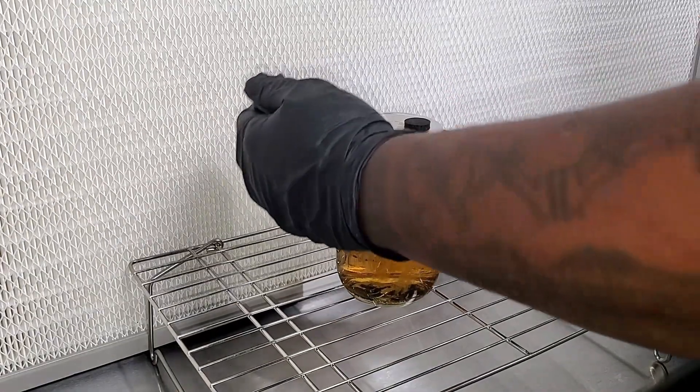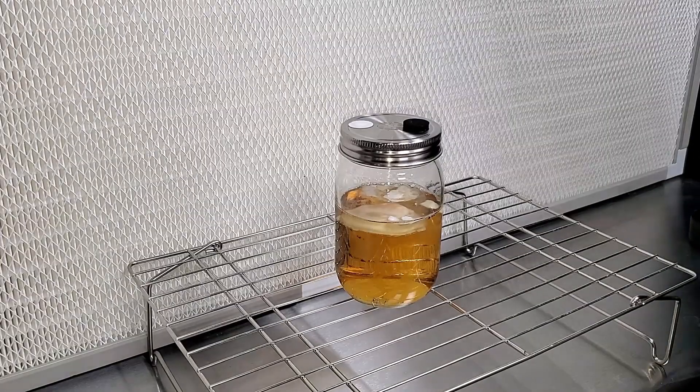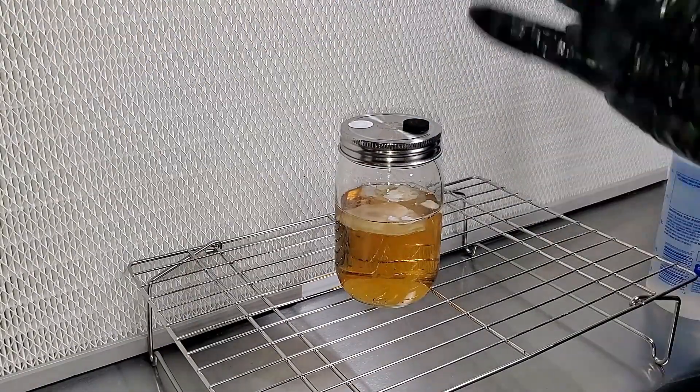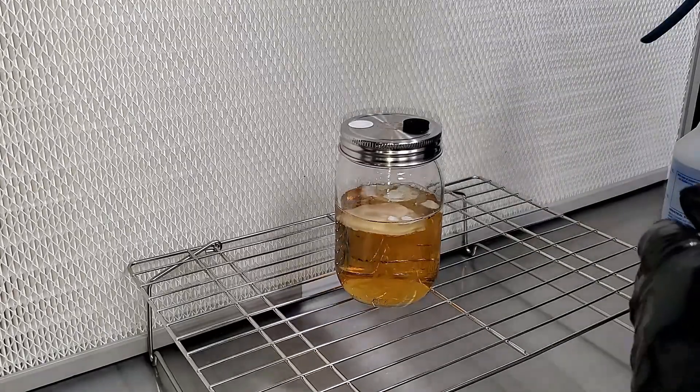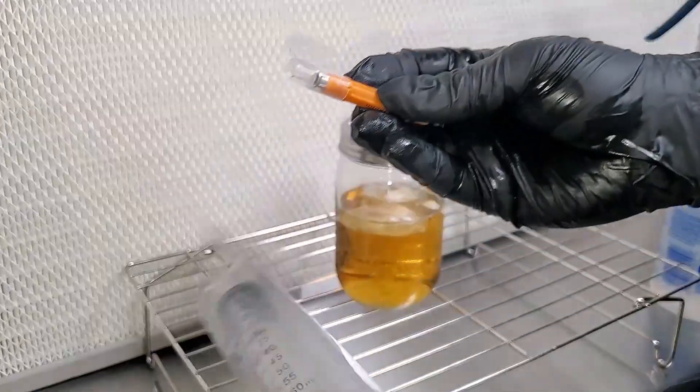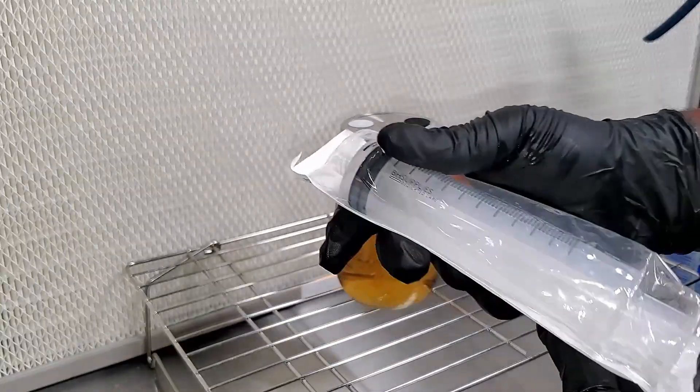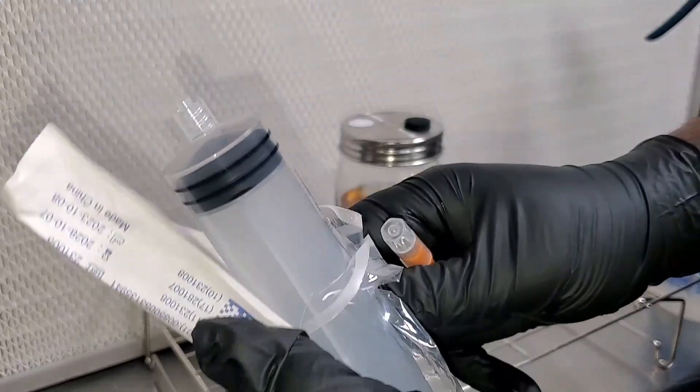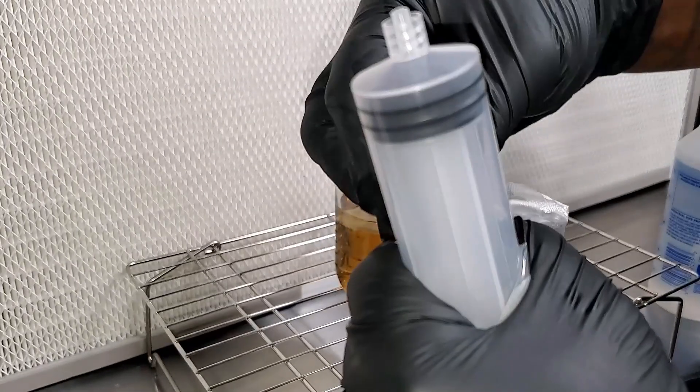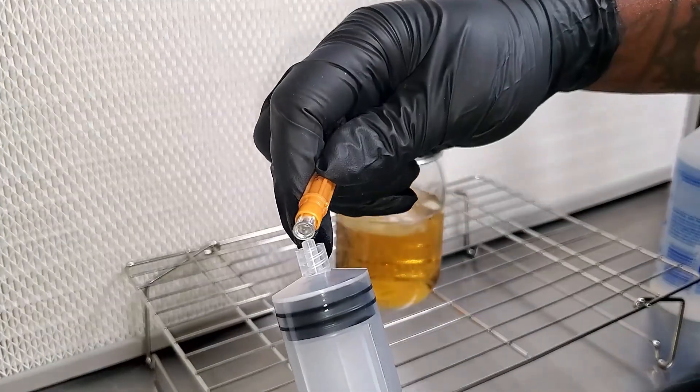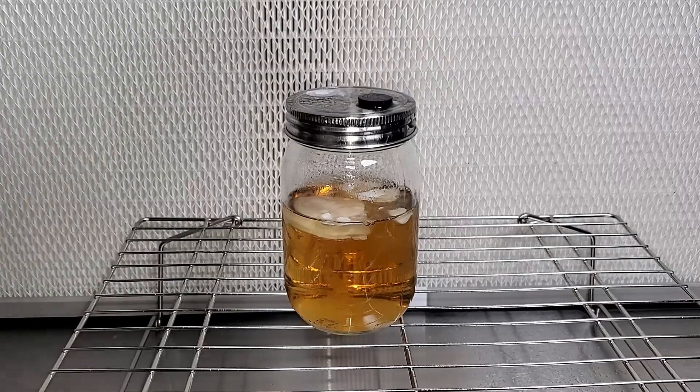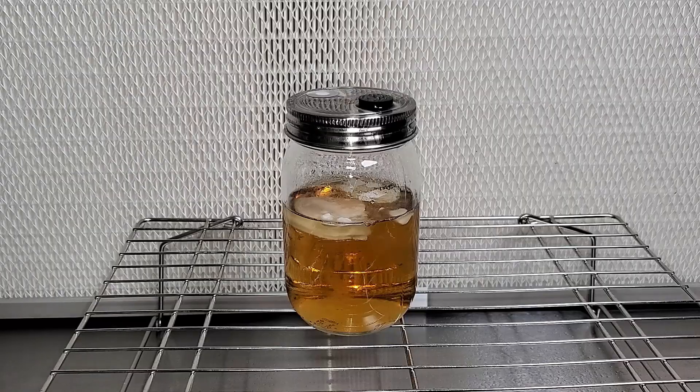So the first thing that I'm going to do is I'm going to take the cover off of the jar. You can see me doing it right here. Now it goes without saying that obviously you want to make sure that your hands, your workstation, everything that you're using is sprayed down with the 70% iso alcohol. I do want to mention to you guys that you don't need a flow hood, a still air box, or none of that for this particular step. You're not opening the jar at all, so you don't have to worry about having a still air box or a flow hood, anything like that. So what I'm going to do now is I'm going to take this 60cc syringe, this 14 gauge needle that comes with the kit, and I'm going to fill this about halfway up. If you want to, you can fill it all the way up, or you can put it on 10 or 20 or 45, or whatever it is that you want to do. I just basically want to show you guys how to use it. So all I'm going to do is I'm going to put the needle on it without touching anything like I always do. The next step is I'm going to spray the top of the jar with the 70% iso alcohol. Once I do that, I'm going to take off the case from the needle, stick it through the injection port.